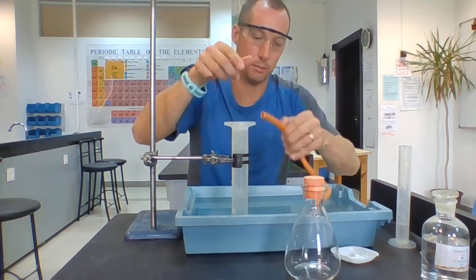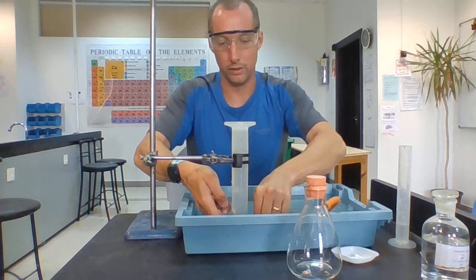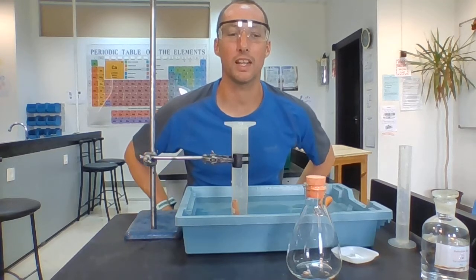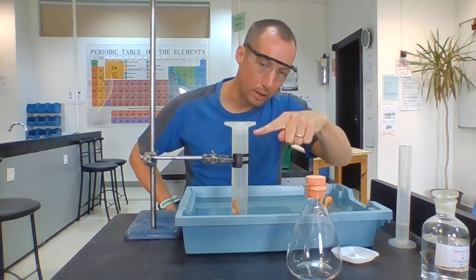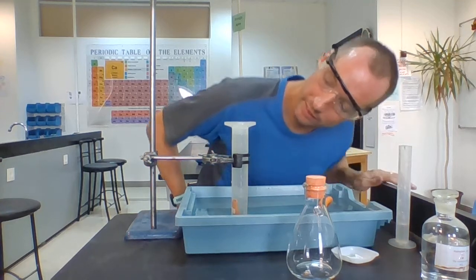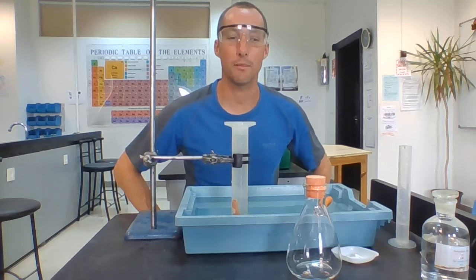I'm going to take the pipe and make it go into the bottom of the measuring cylinder, and you can see some bubbles are already coming up. Now that's kind of an error in my experiment because those are bubbles of air which have escaped. So I don't know how well you can see, but my measuring cylinder is now not completely full of water. There's some air in that. So I can already see on mine that there's almost 10 milliliters of air. That means I need to subtract that from the volume I collect.